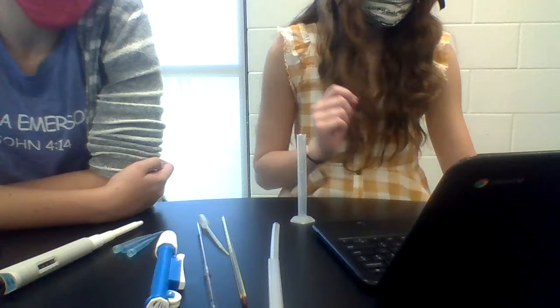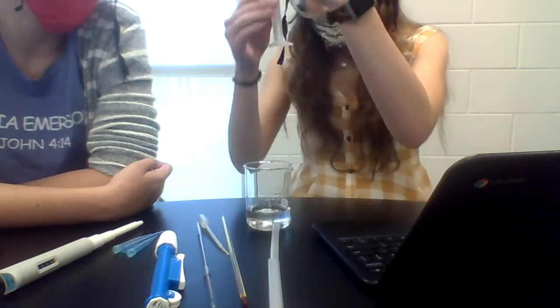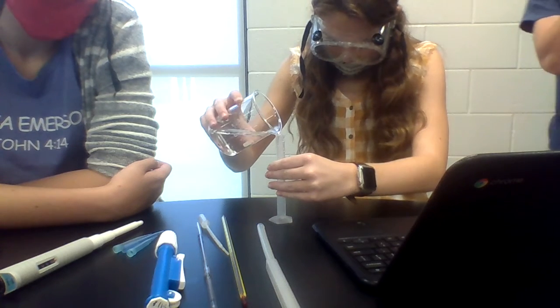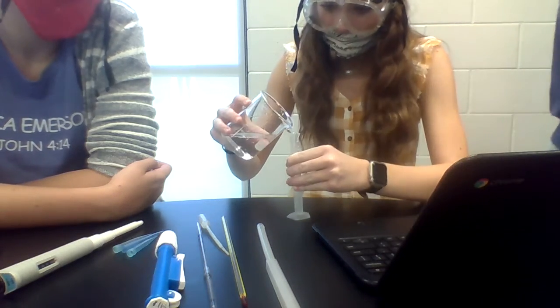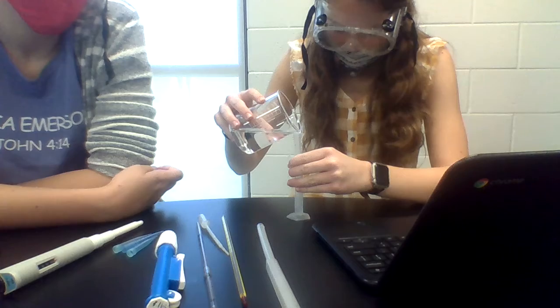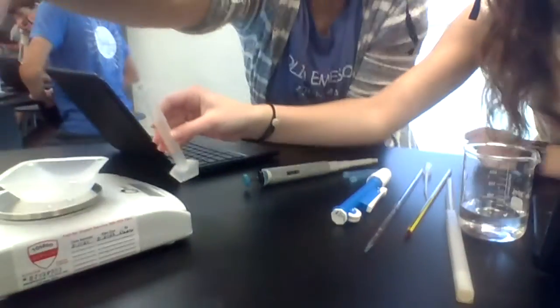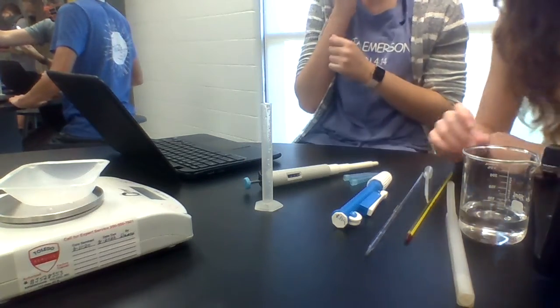Okay, next. You have 1.1. That means you're at this line, and you make a halfway between this line and the other line, right? That was a little bit much. That was too much. So with the graduate cylinder, let's write it. Right now, that meniscus is about... actually a little bit. I'm gonna put a little bit more. Okay, you think that's about one? Alright, 1, 2, 3. Did it work? Alright, that one got us to like 1.4 something.